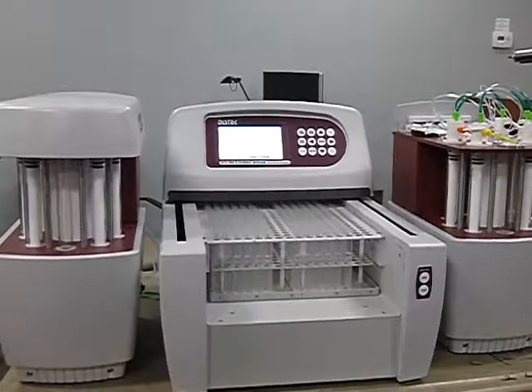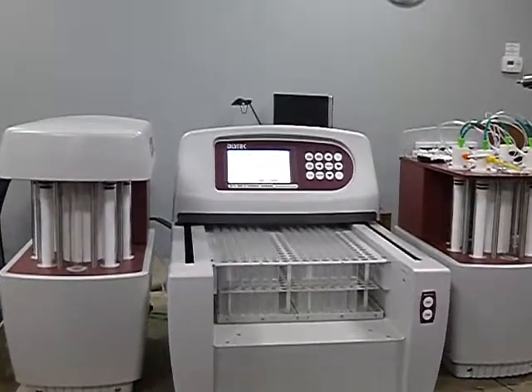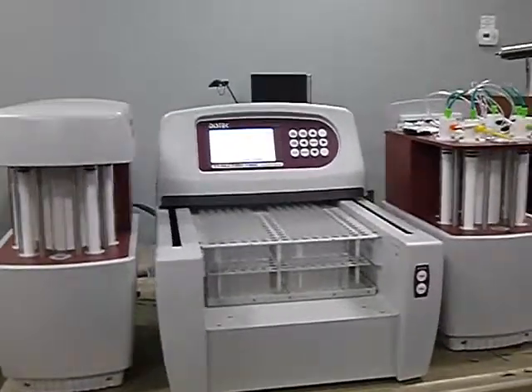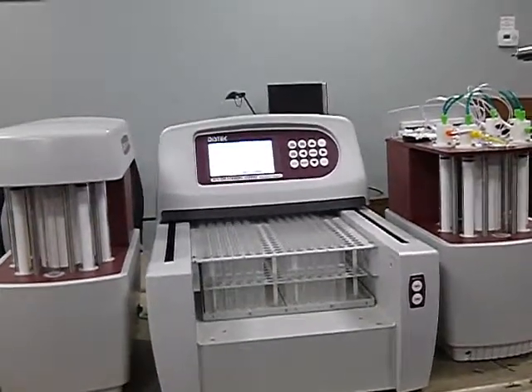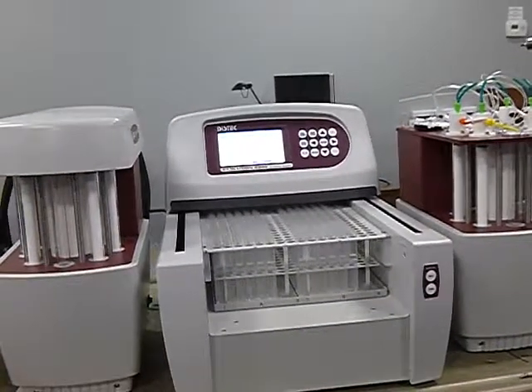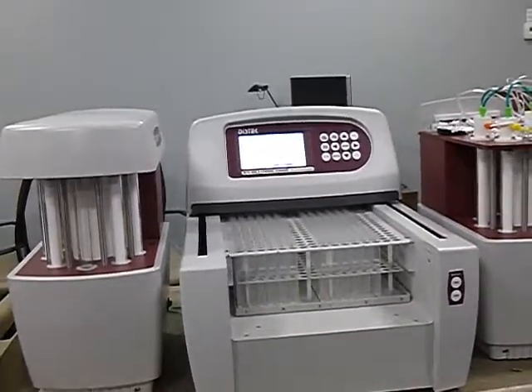Then the pH portion is done, so you can take your time. You still have over 5 minutes to take them all out and put them back in a beaker. Start measuring. Yes, and start weighing back. You want to be there for that 45 minutes because you need that 45-minute time as part of your protocol.